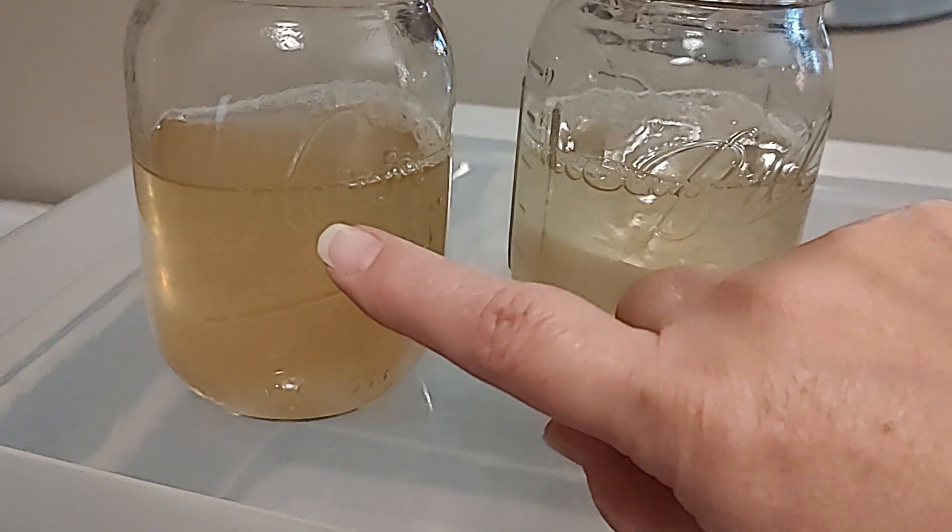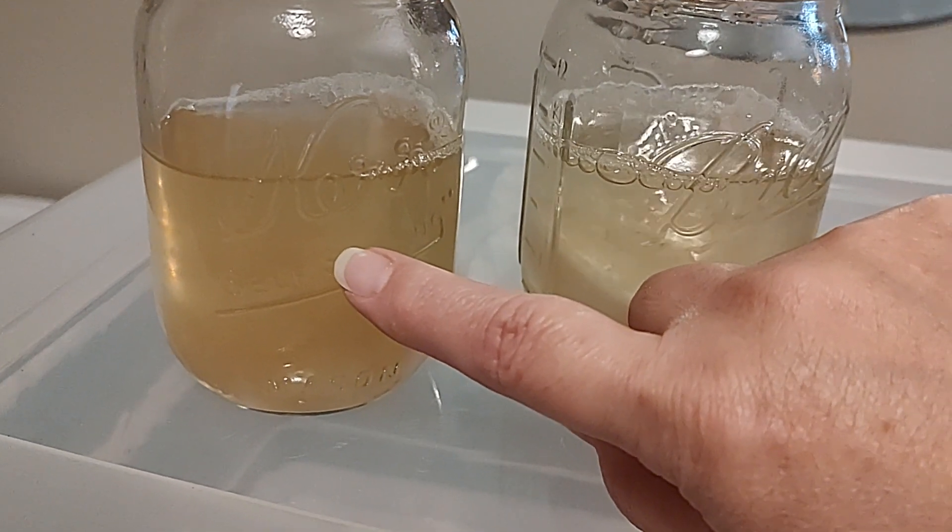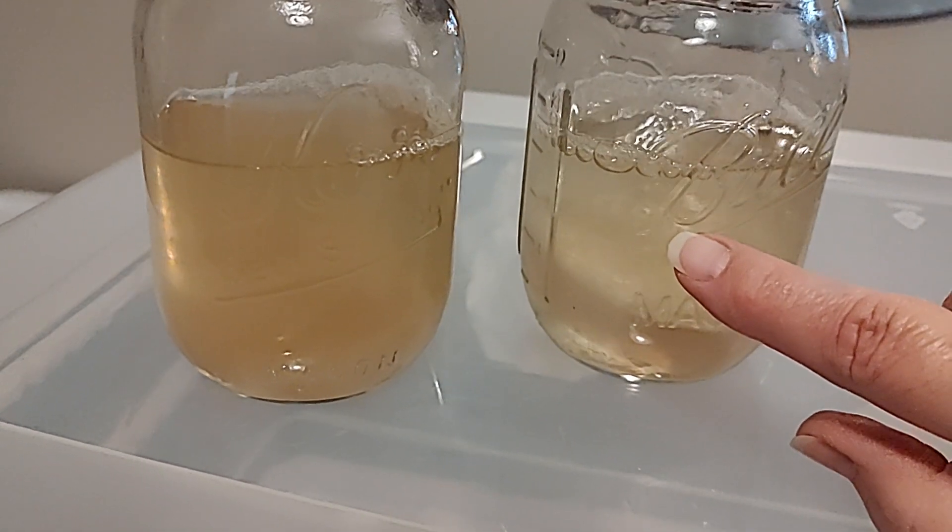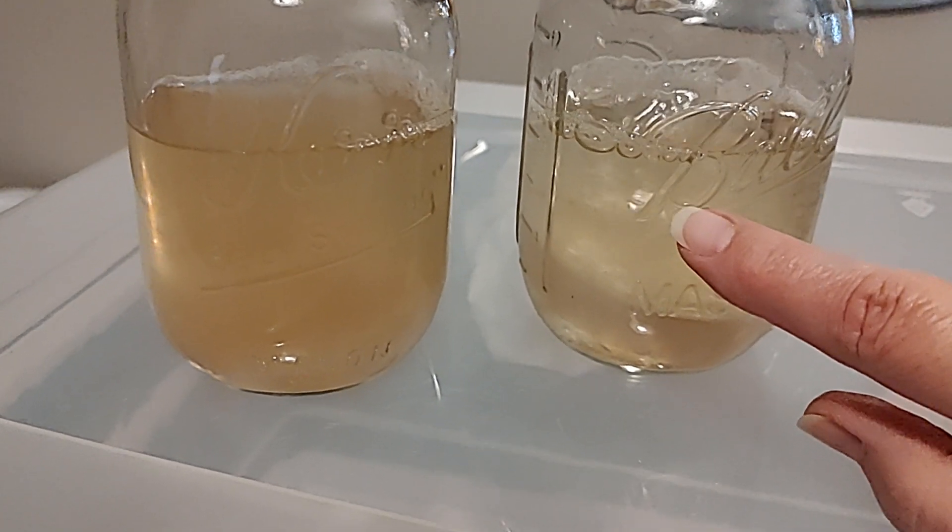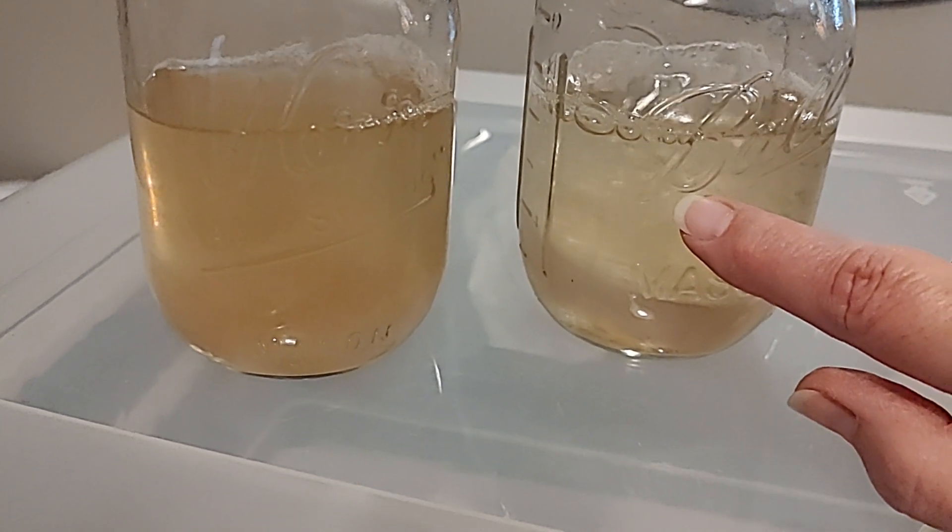I'm going to get a syringe out and take a syringe of this LC, then I'm going to get a different syringe out - two clean syringes - and use a syringe here.